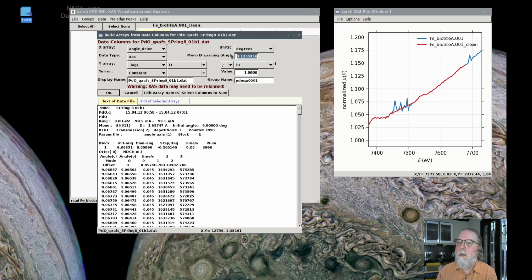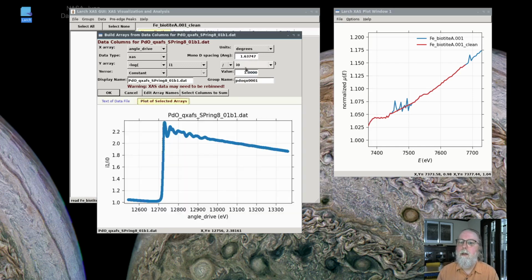So if we select that, paste that in, 1.637, and hit return, then that will show that the energy is around 24 keV, which is correct. And now we are able to read this data in correctly. And it even says, warning, the XAFS data may need to be rebinned.